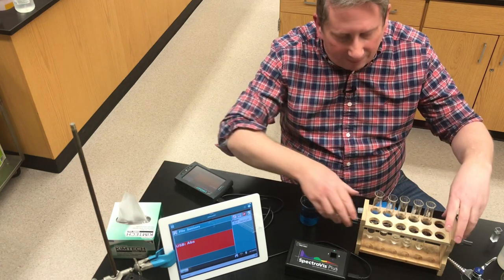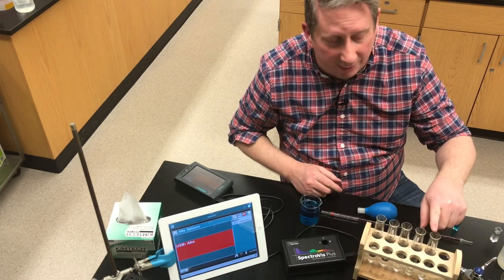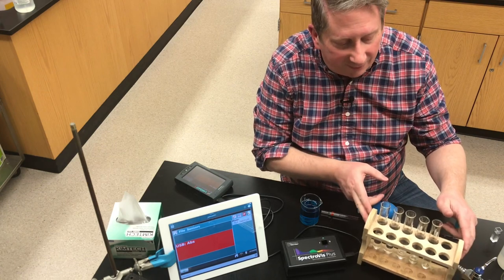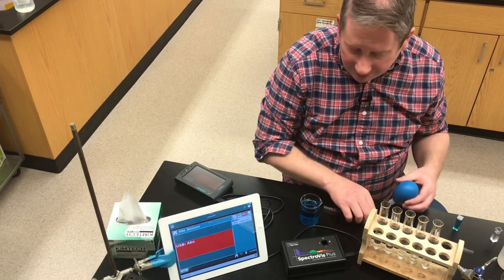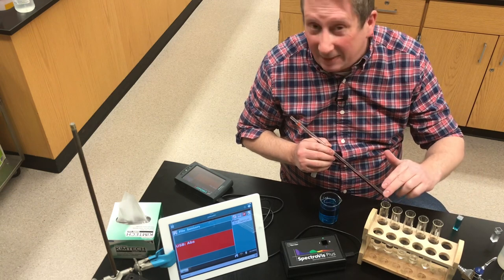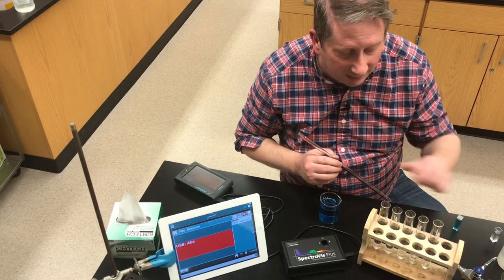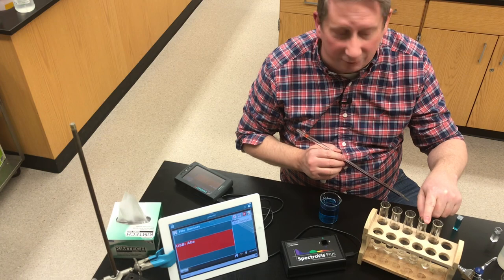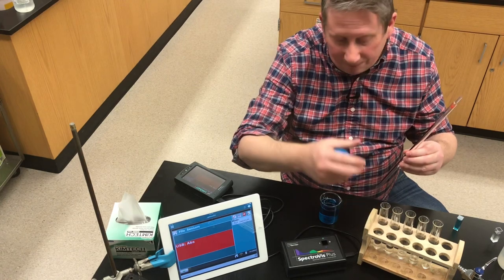To begin, I've got test tubes filled with distilled water — one milliliter, three, five, seven, and nine milliliters respectively. You may want to create your own data table. I'm going to pipette malachite green solution into each to make ten milliliters total in each test tube. So the tube with one milliliter of water gets nine milliliters of malachite green; the tube with three gets seven, and so on.